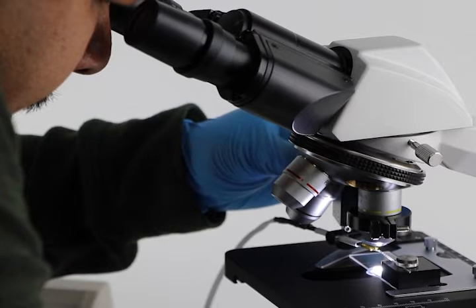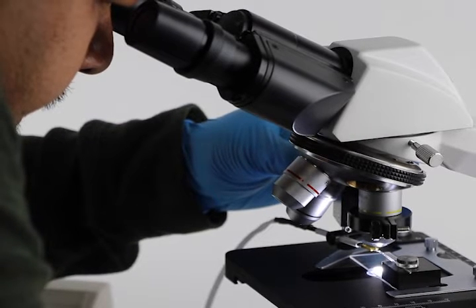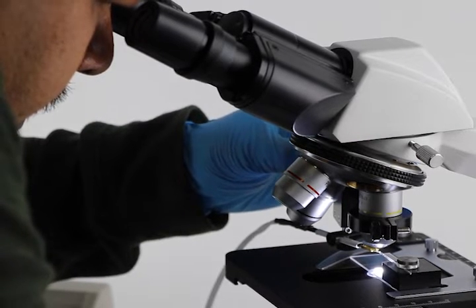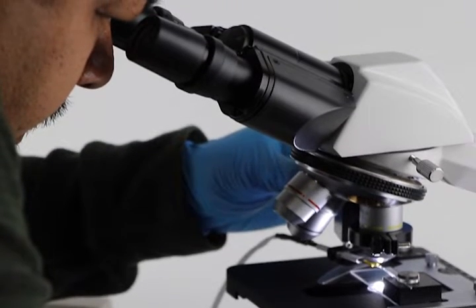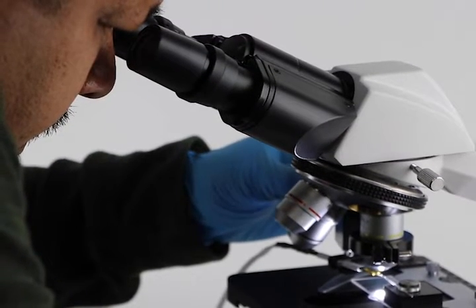Looking through the microscope, move the filament in the filament clamp until its shadow appears. Some vertical adjustment may also be required to bring the shadow into the field of view.